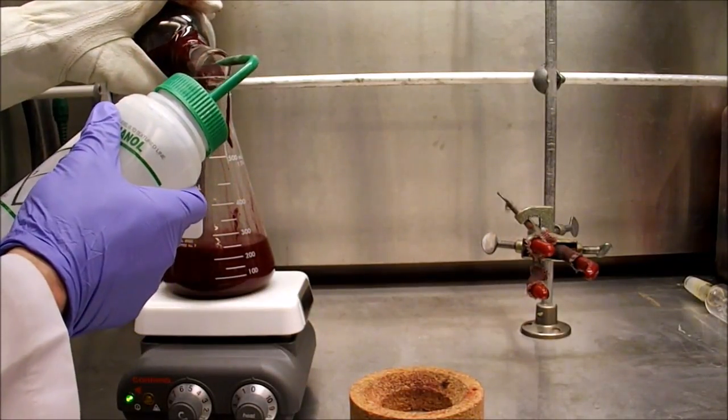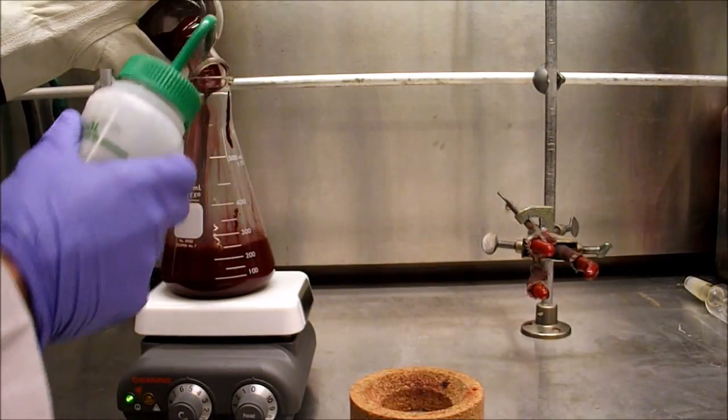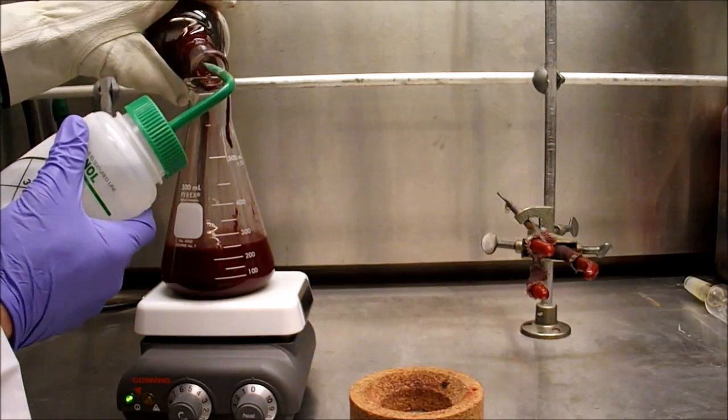If the reaction mixture solidifies, it can be very difficult to remove from the round bottom flask. This transfer must also be done carefully since the reaction mixture is still very hot.